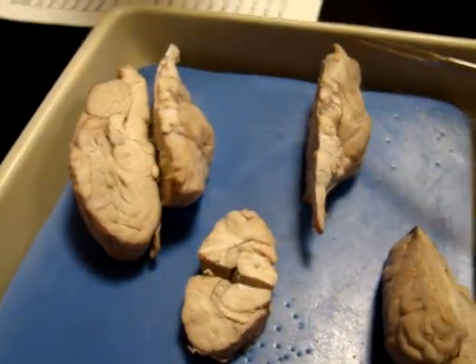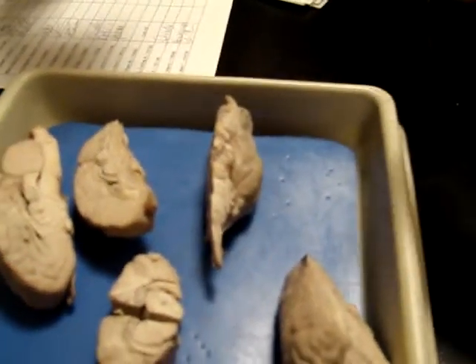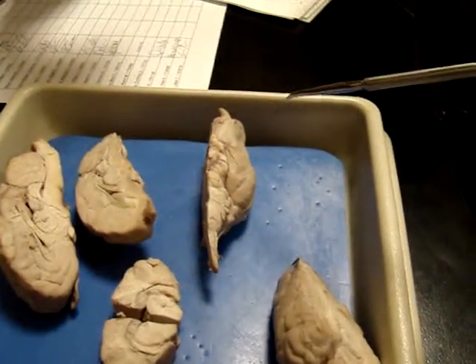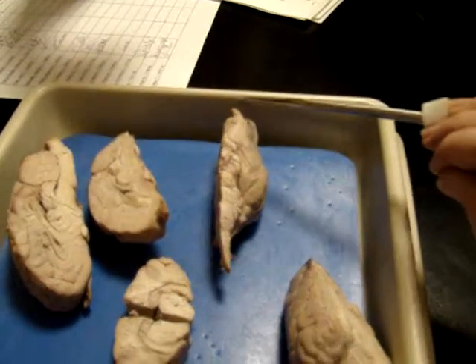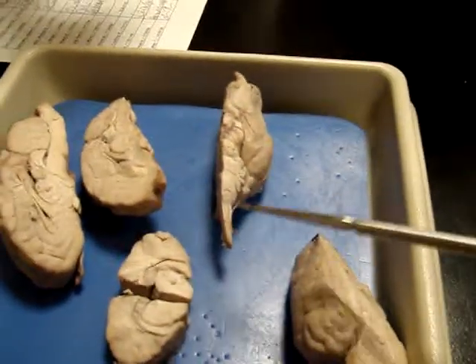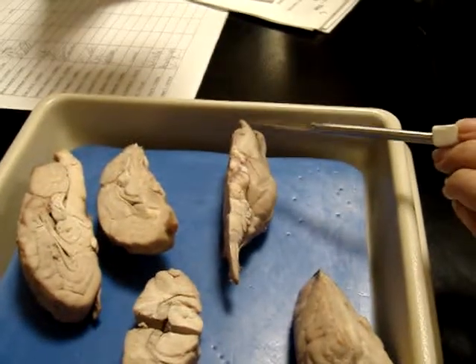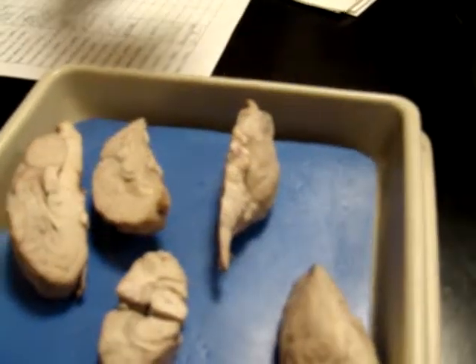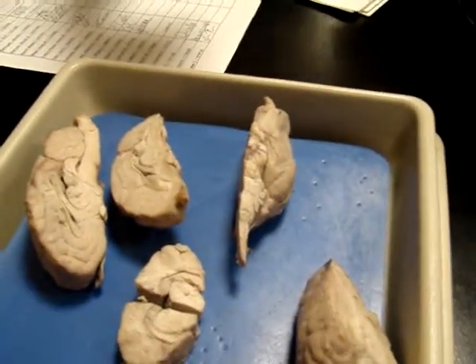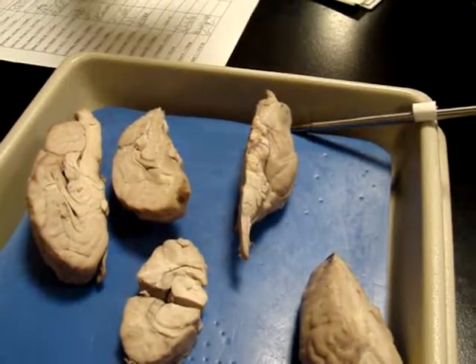So the olfactory nerves actually come from the olfactory epithelium. Remember that? They have receptors, odorant receptors, and then they go through the ethmoid bone, the olfactory foramina, those little holes, where those then go up and synapse on these olfactory bulbs to the second neuron in the chain. So the olfactory nerves are out here, and they lead up and synapse on the olfactory bulb. Then the impulse goes back through the tract into the brain. They go through the cribriform plate, the olfactory foramina of the cribriform plate of the ethmoid bone.